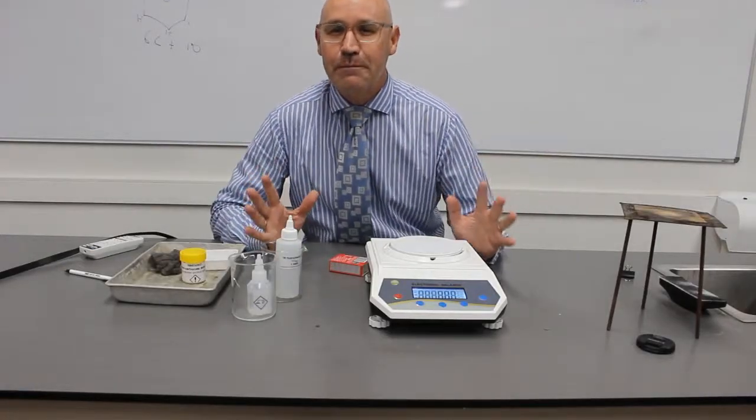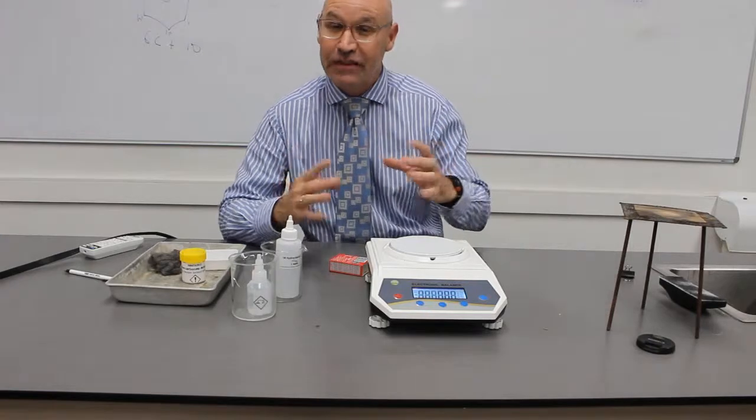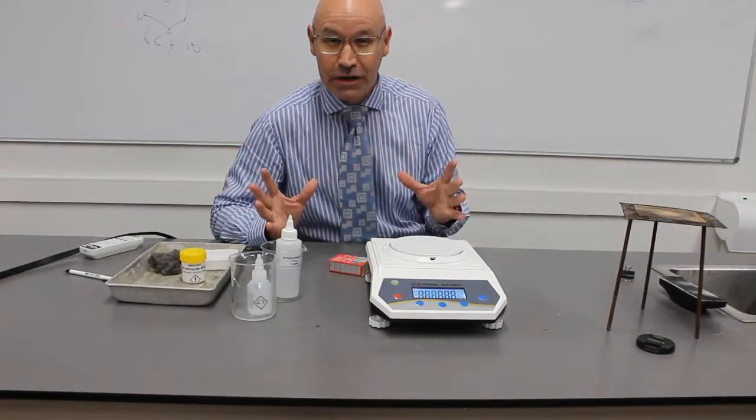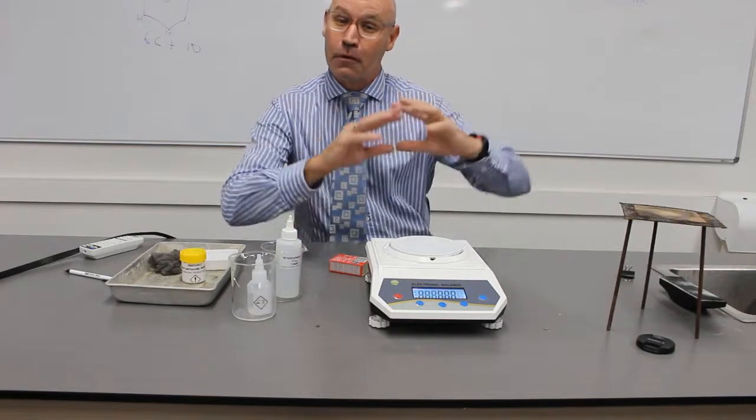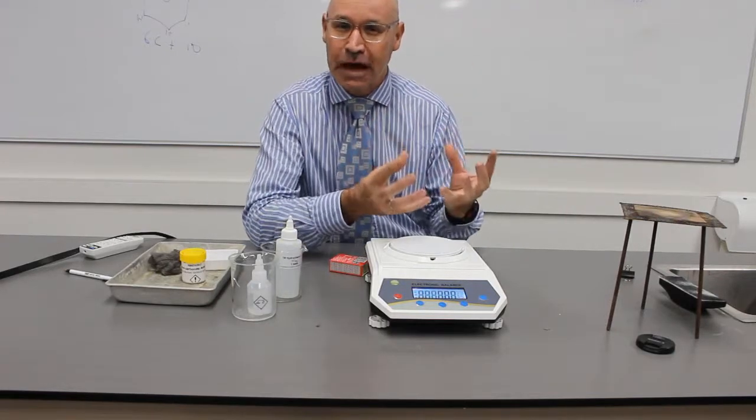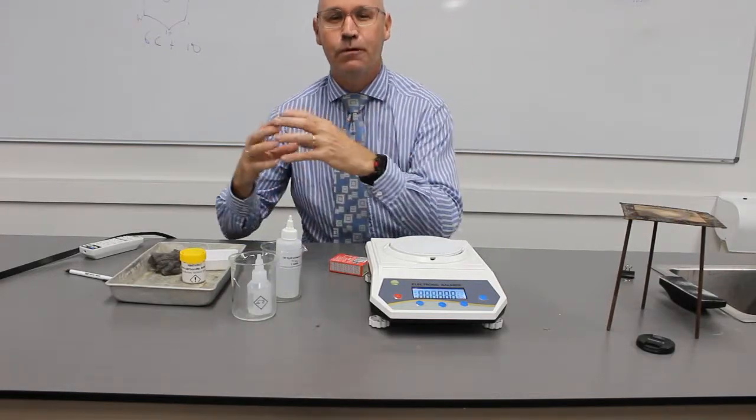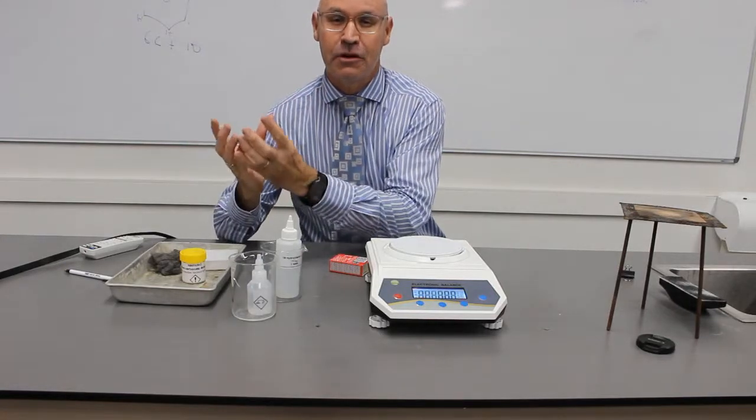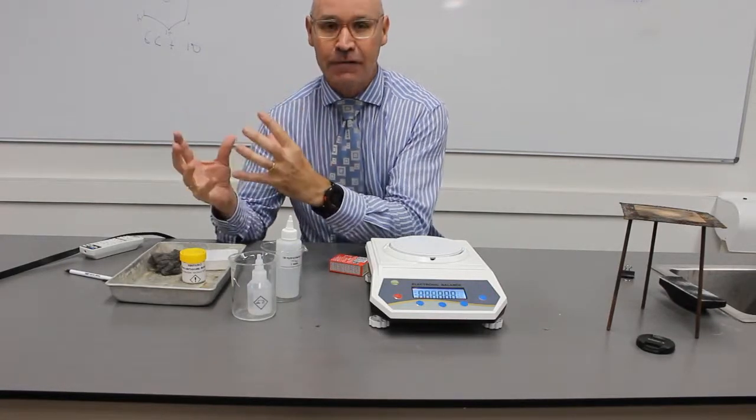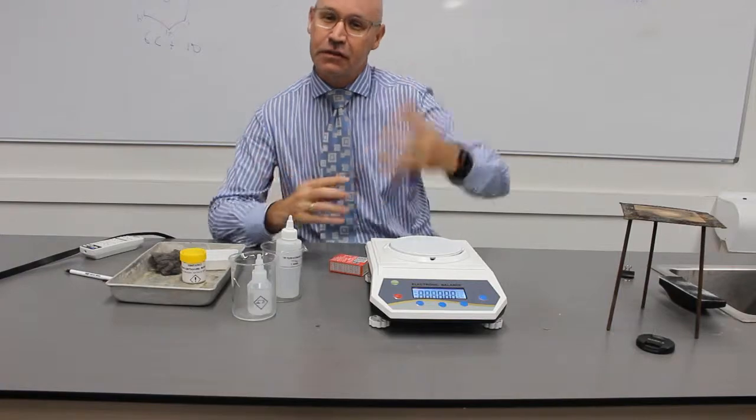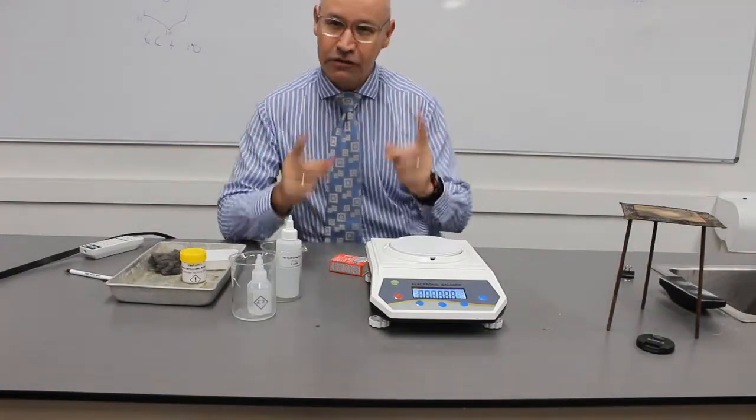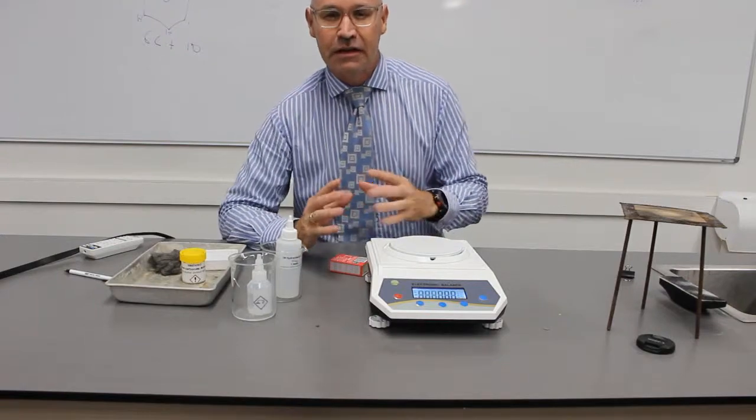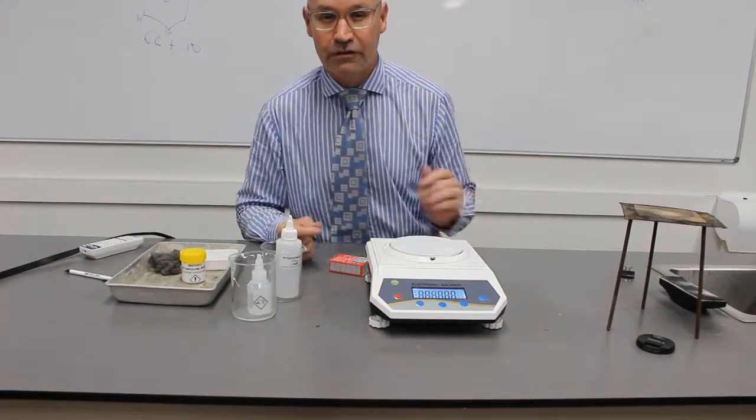The law of conservation of mass states that mass is never created or destroyed. So that means that the number of atoms of the reactants before a reaction must be equal to the number of atoms of the products after a reaction. They've got the same mass of the reactants to the products. I'm going to do three experiments now to demonstrate the law of conservation of mass.